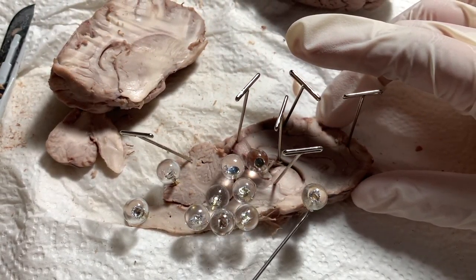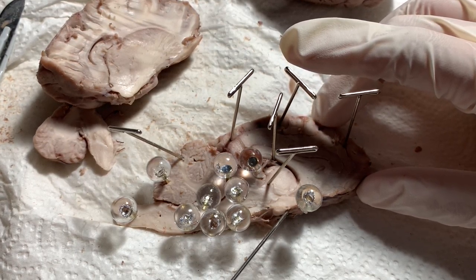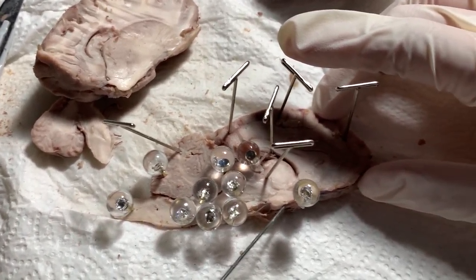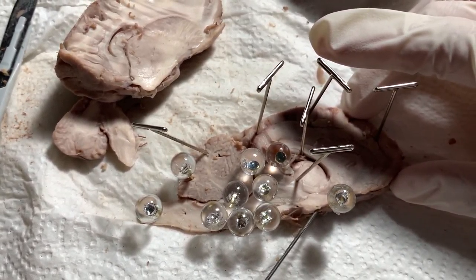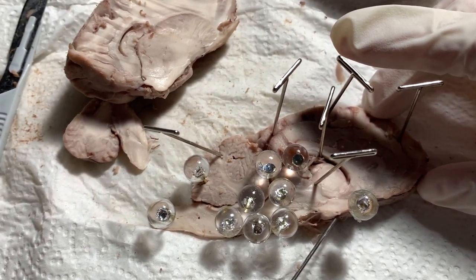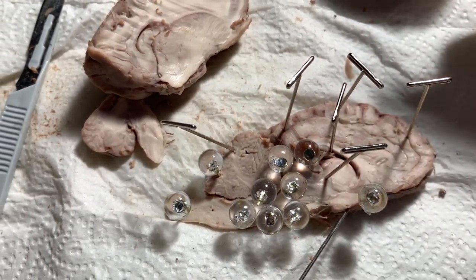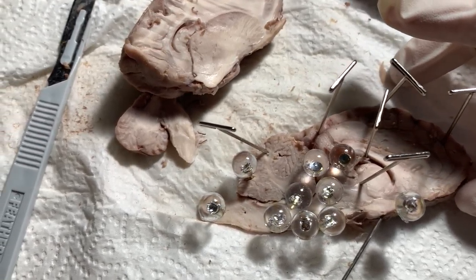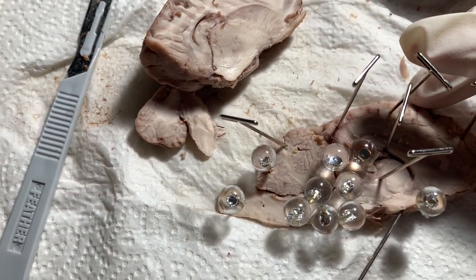Next we have the optic nerve. The optic nerve's objective is the main connection cell system between the brain and the eyes, enabling vision, color detection, and proper balance. This helps with preventing falling and bumping into objects and acquiring food.